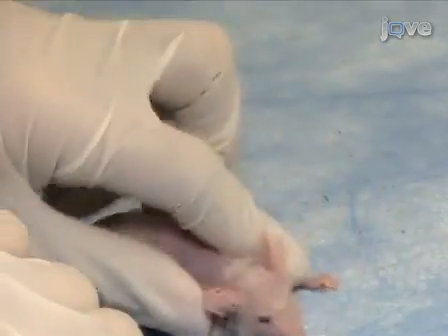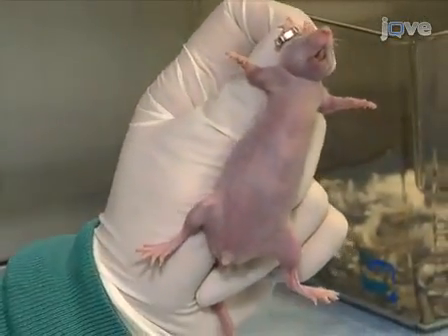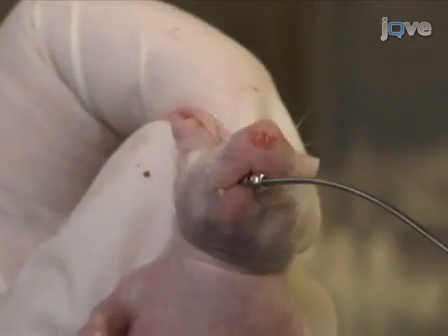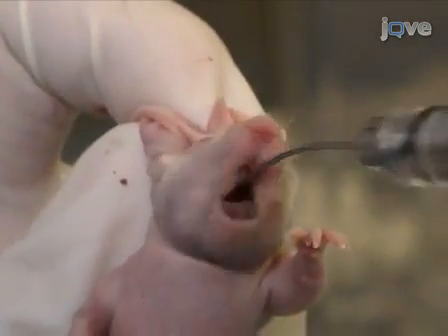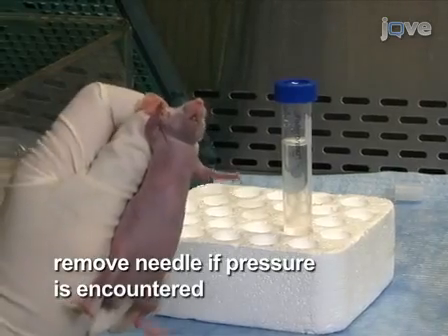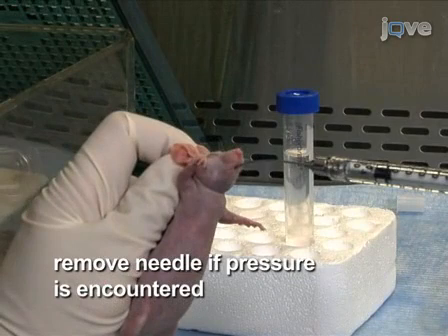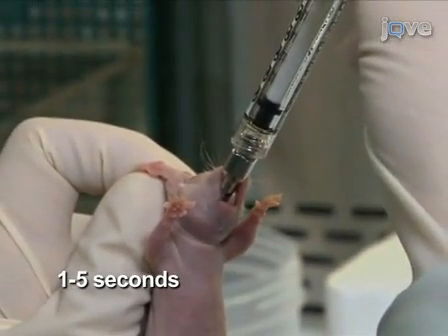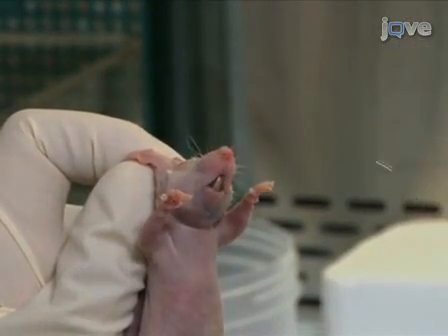Next, restrain the mouse using the same grip as shown for the intraperitoneal injection. Insert the gavage needle into the mouth, over the tongue, and advance the needle through the pharynx. To avoid puncturing the esophagus, do not insert the needle past the stopping mark. The needle should proceed smoothly without any pressure. With the needle in place, slowly depress the plunger. Remove the needle at the same angle that it was inserted.